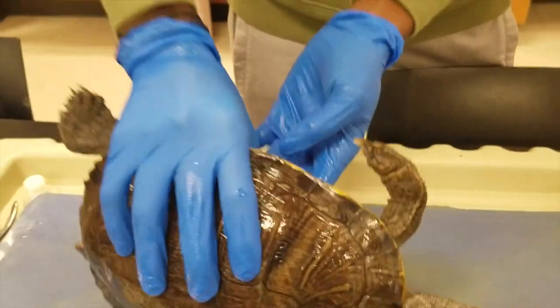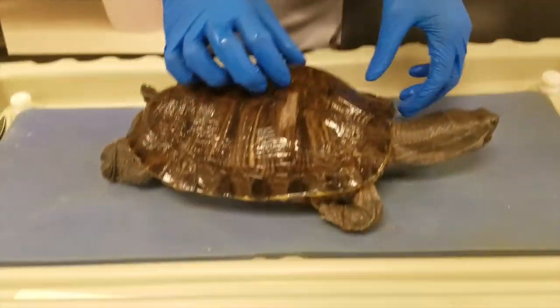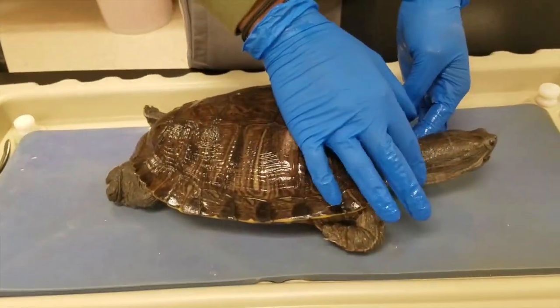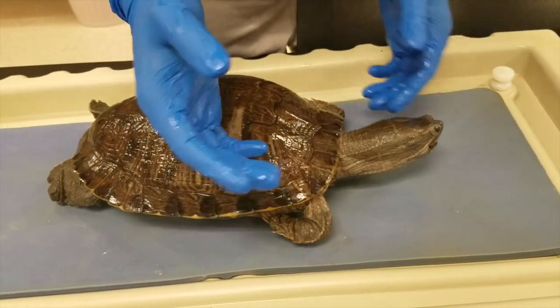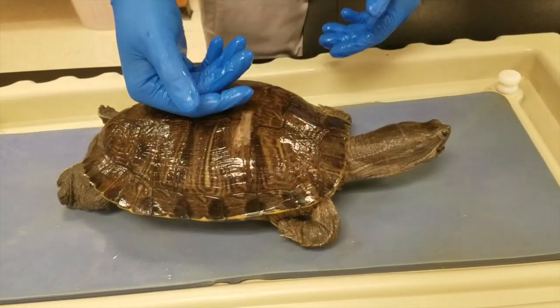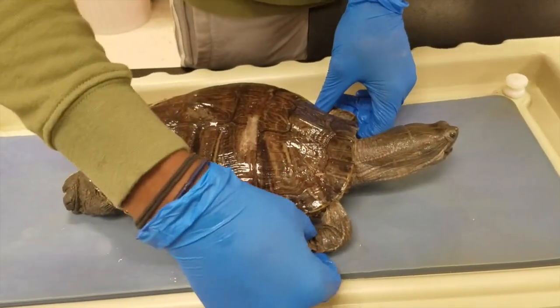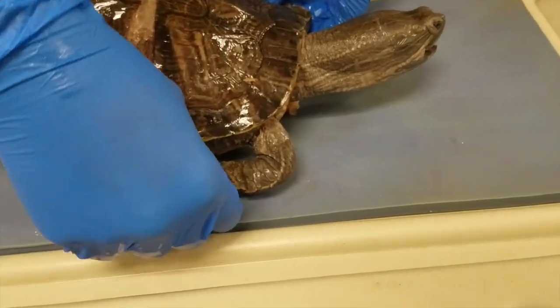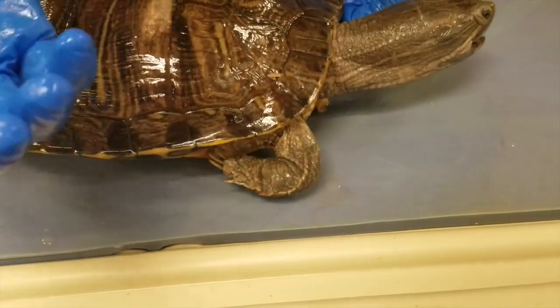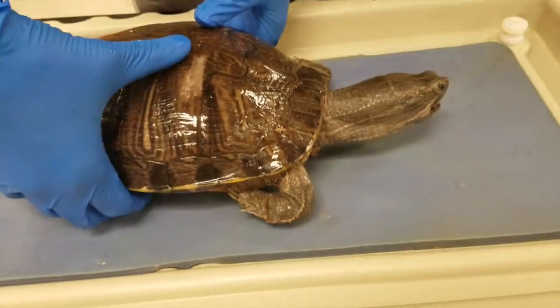Some more adaptations that the turtle has are scaly skin to prevent desiccation and abrasion from the wind. It also has claws right here for digging and laying eggs and things of that nature.